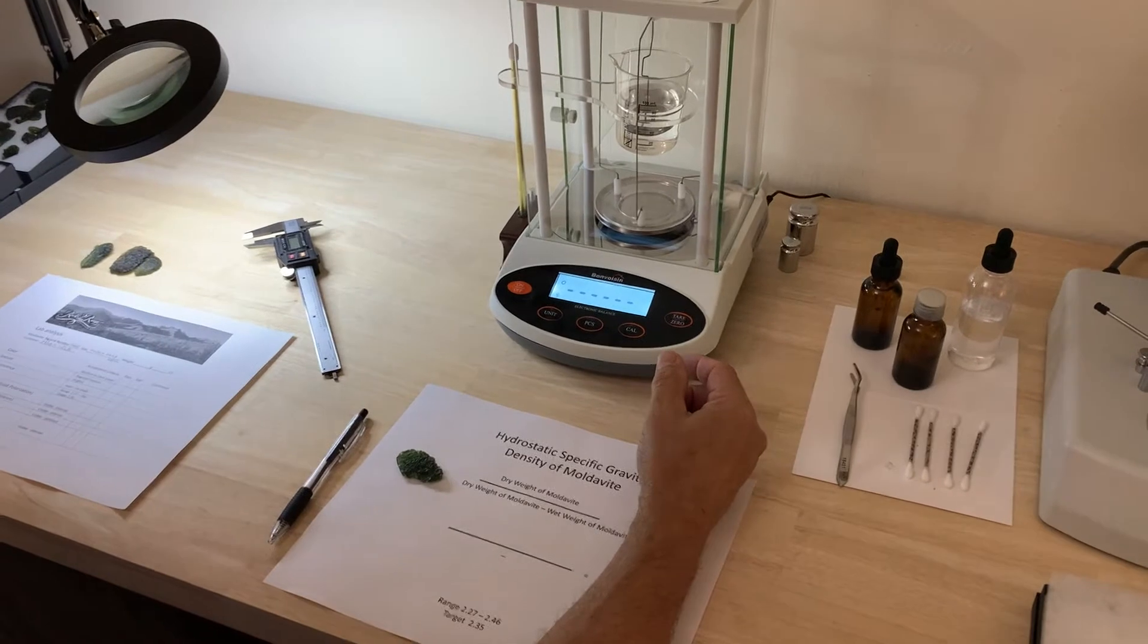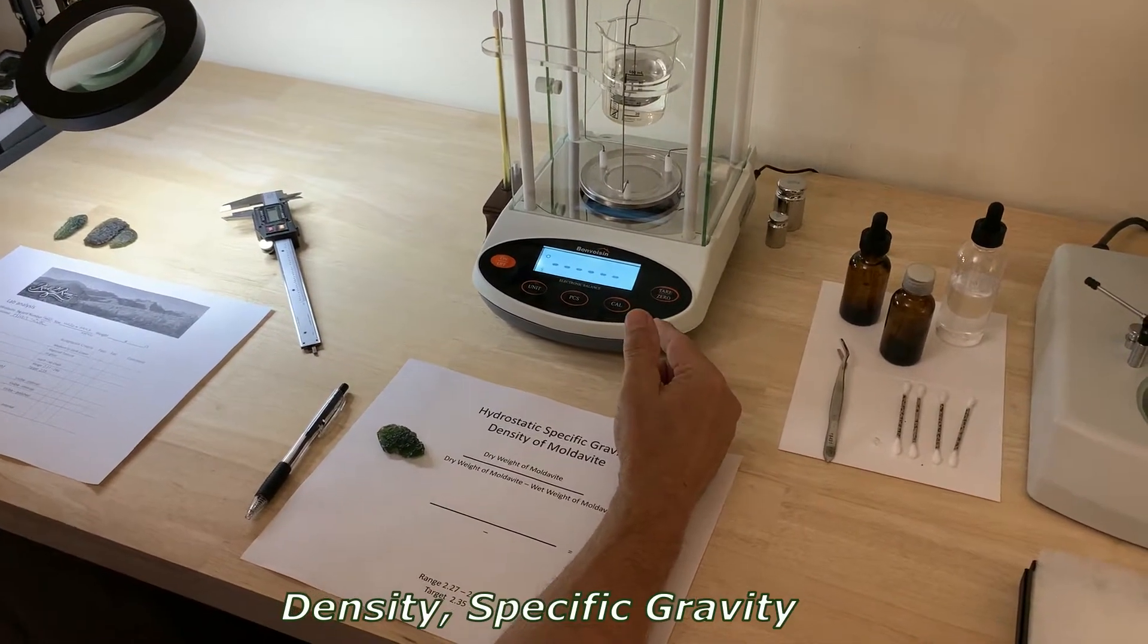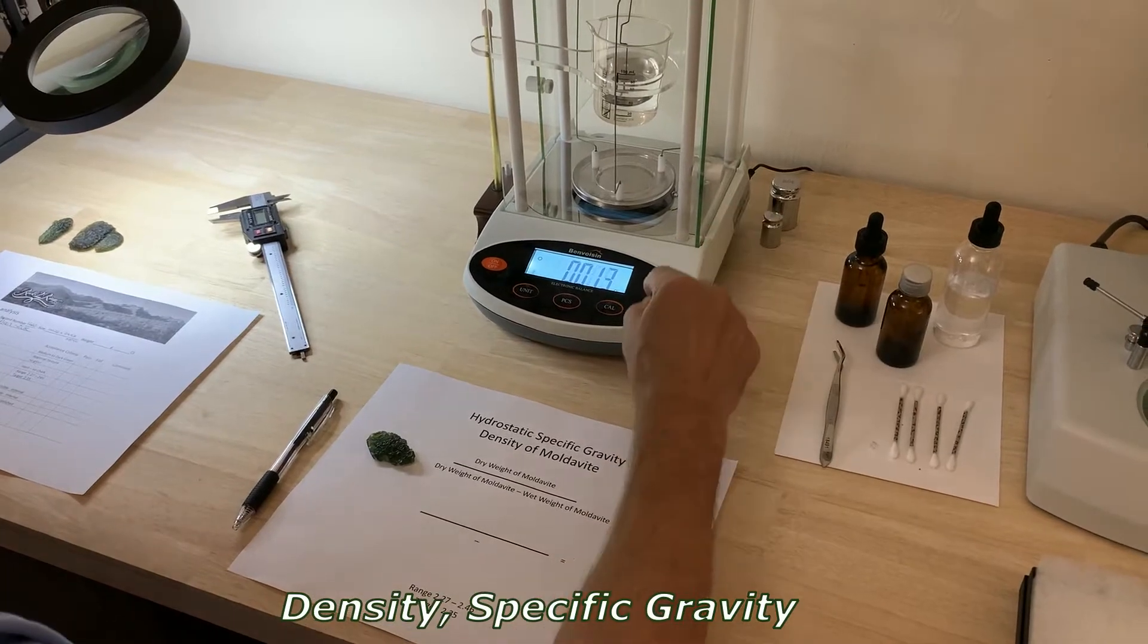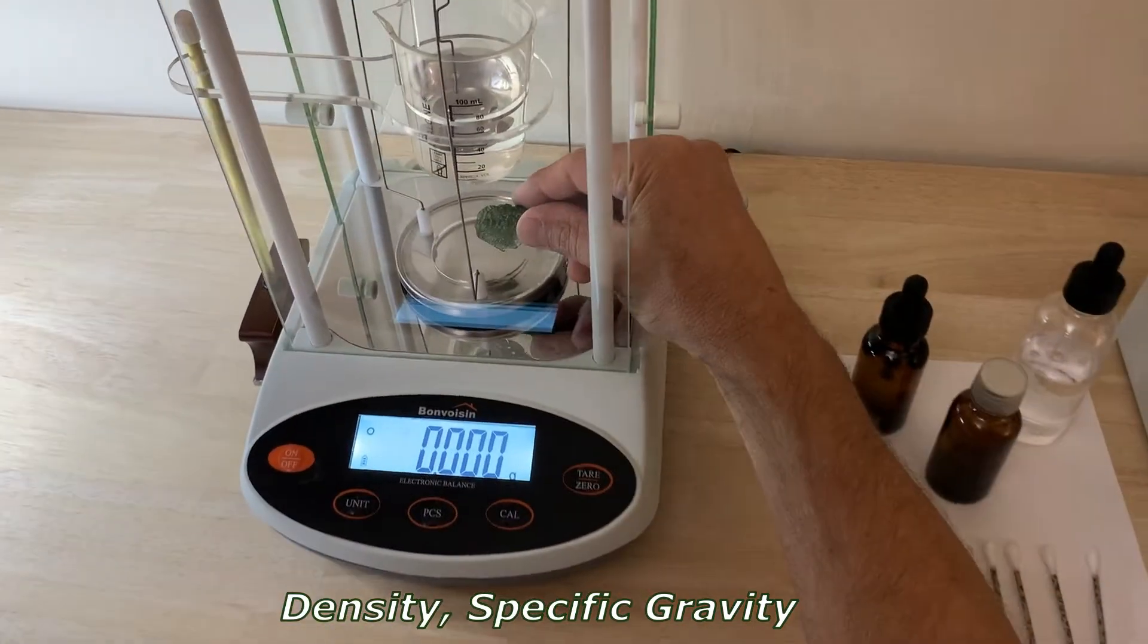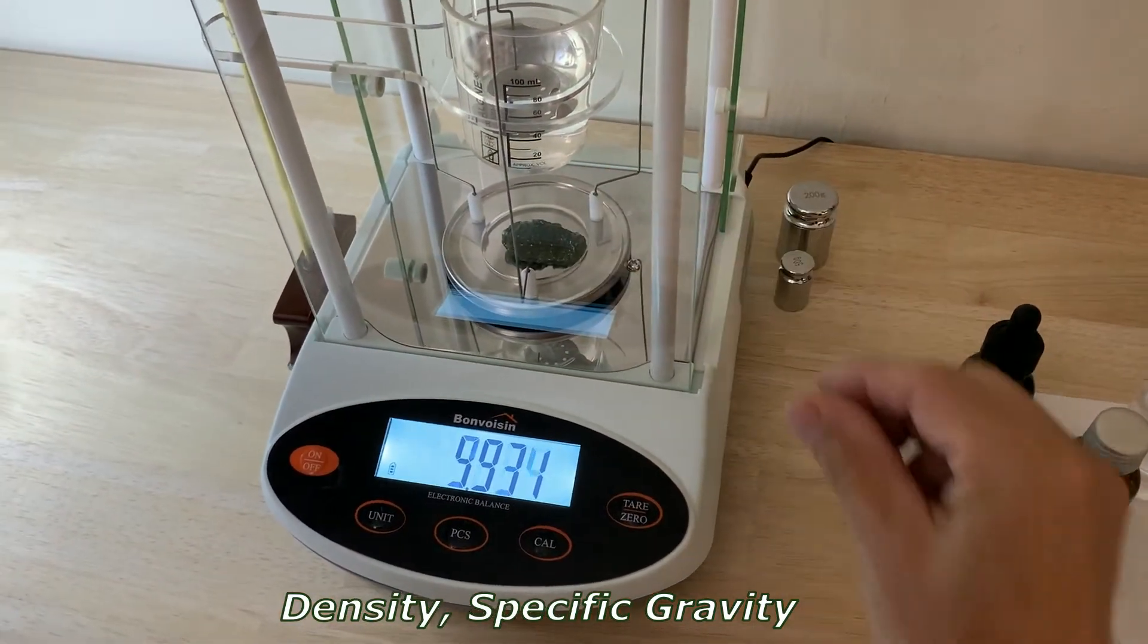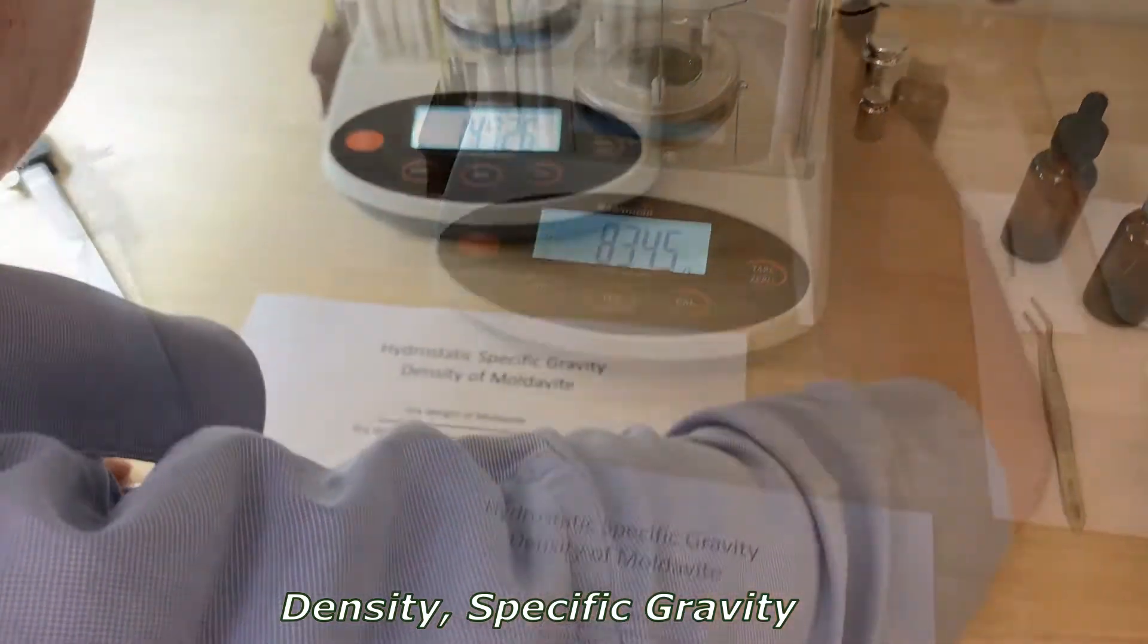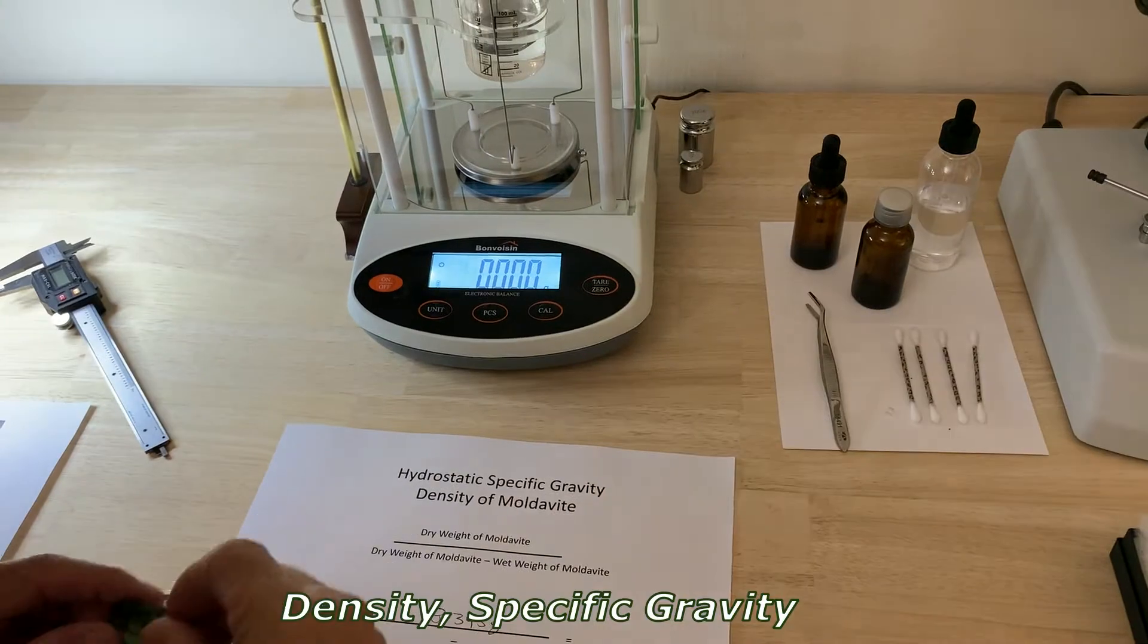This balance is designed to not only weigh the sample but to determine the specific gravity. First we weigh the dry sample, and it is 8.345 grams.